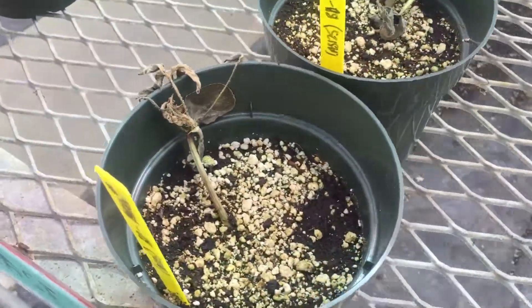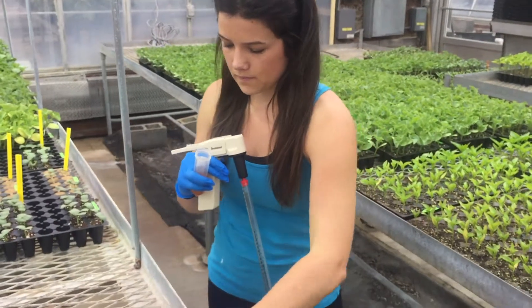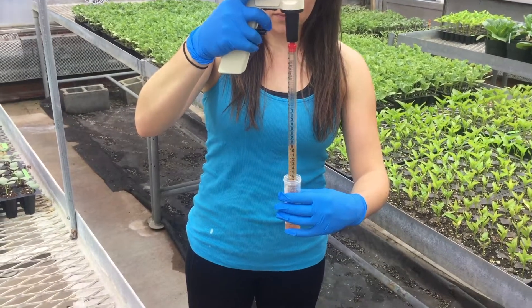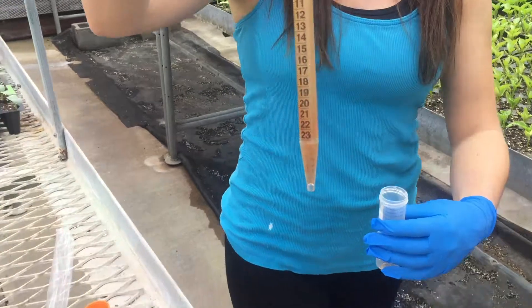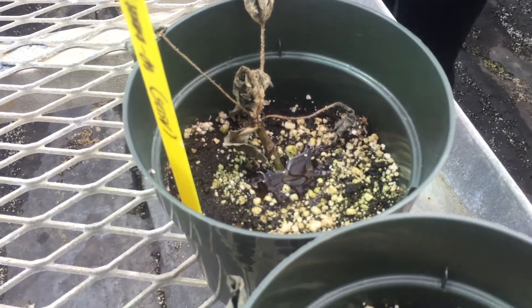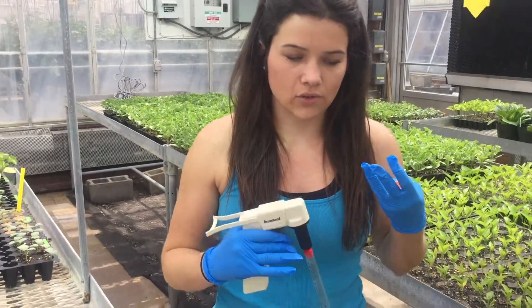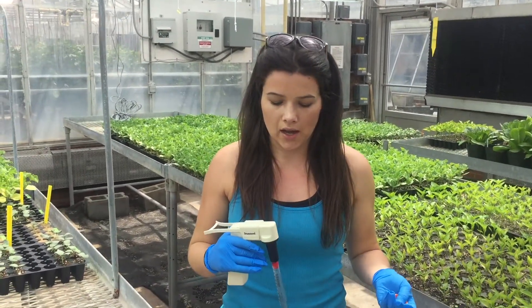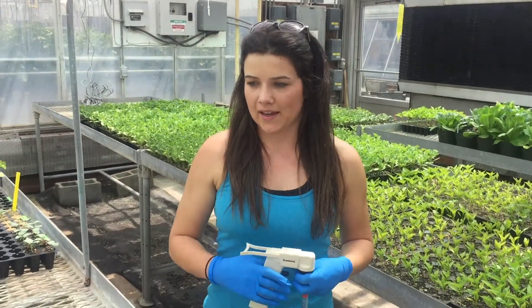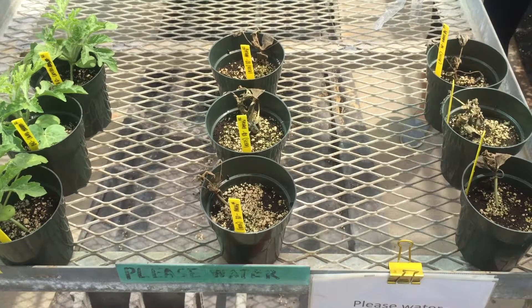I'll show you how to do an inoculation using the pipette and release it at the base of the plant. The conidia will be attracted to the root exudates and be translocated through the root system up to the vascular tissue and then colonize within the vascular tissue, causing wilting of the plant. Here's our control and our inoculated seedlings — it's pretty lethal stuff.